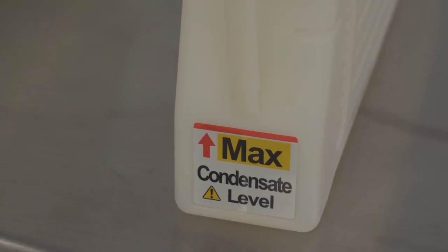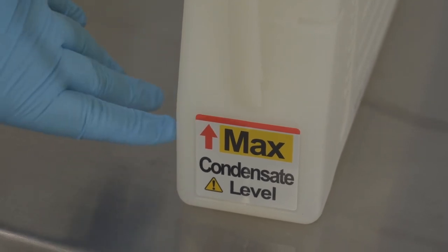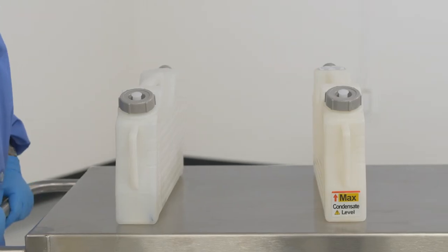The only bottle without tubing is the condensate bottle. The bottle is clearly marked and is only meant to collect fluid. It should be kept empty.